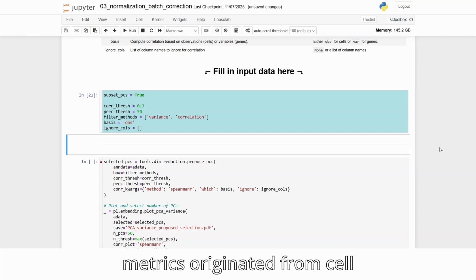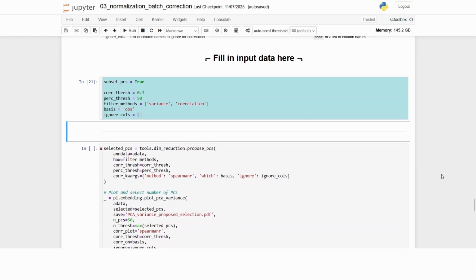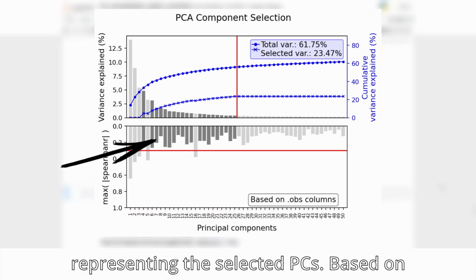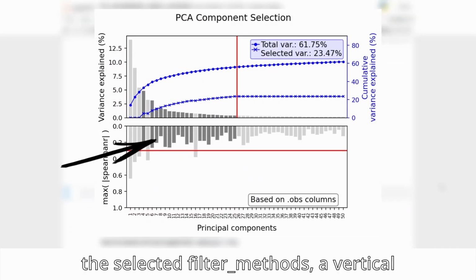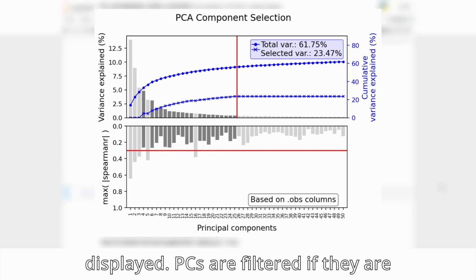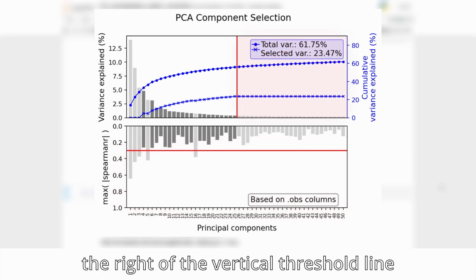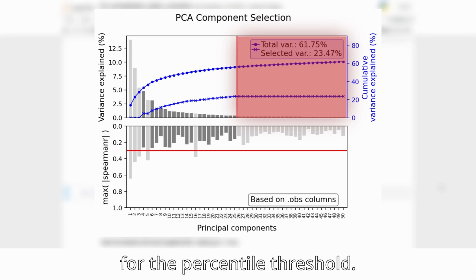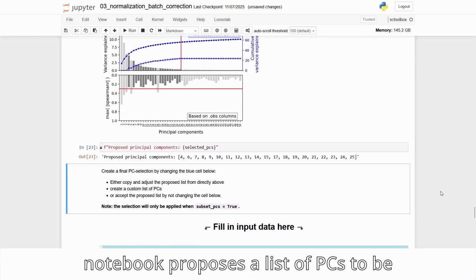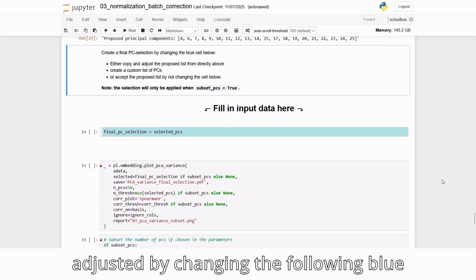As all correlated metrics originated from cell annotations, we leave the reference source as OBS. In the bar plot, the proposed PC subset is displayed with darker bars representing the selected PCs. Based on the selected filter_methods, a vertical and horizontal threshold line is displayed. PCs are filtered if they are below the horizontal threshold for the correlation threshold, or if they are to the right of the vertical threshold line for the percentile threshold. With these selected parameters, the notebook proposes a list of PCs to be kept. This list is not final and can be adjusted by changing the following blue input cell.